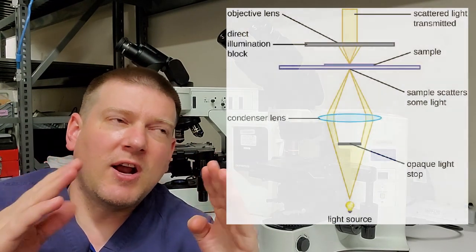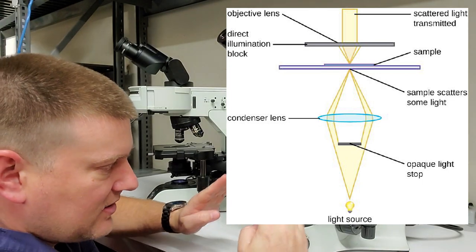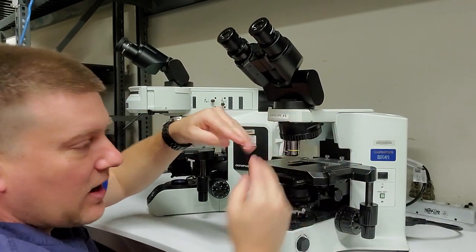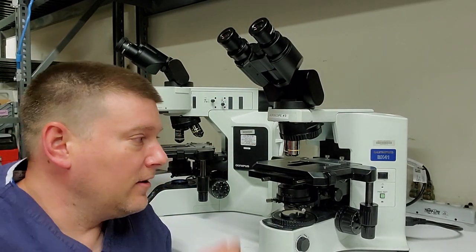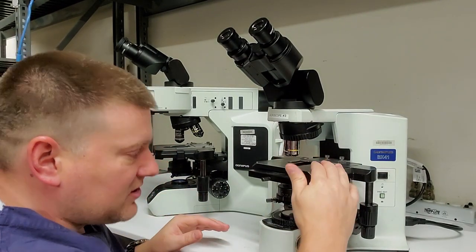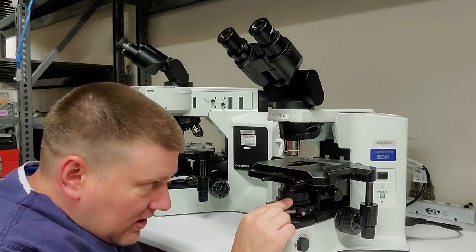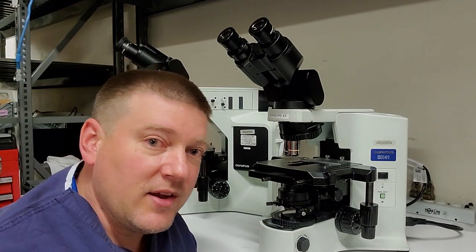Think of it as two triangles, apex to apex. So your bottom triangle is your condenser. It wants to condense the light down to a triangle. And you have to think of your objective as a top triangle facing downwards. Okay? And you want those two points to kind of match up to be like the perfect amount of light based on the objective. Okay? So we have our stage, we have our condenser. Beneath our condenser, which, you know, you can move your condenser up and down, and the condenser has an aperture which will increase and decrease the surrounding light around the outside of it.